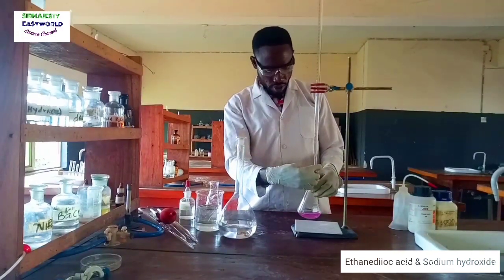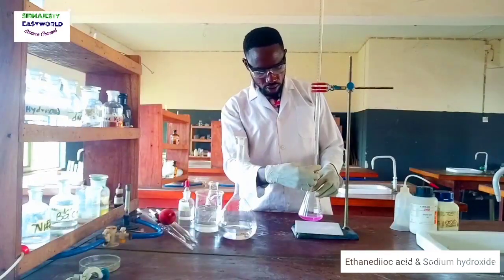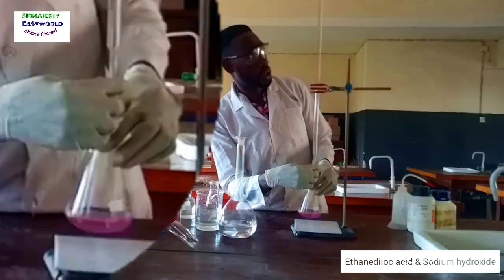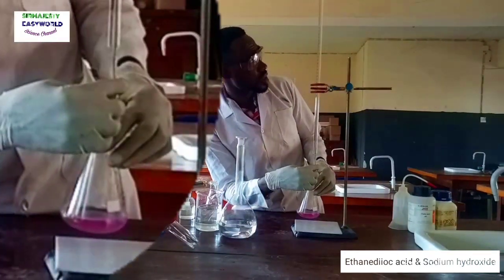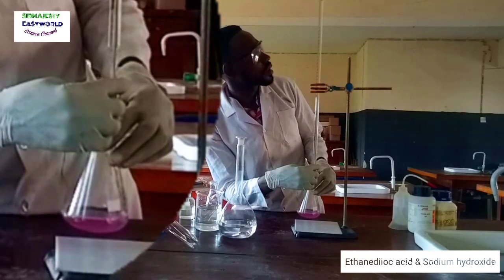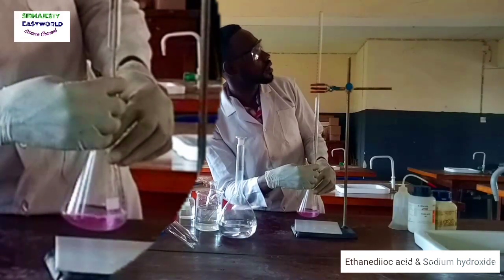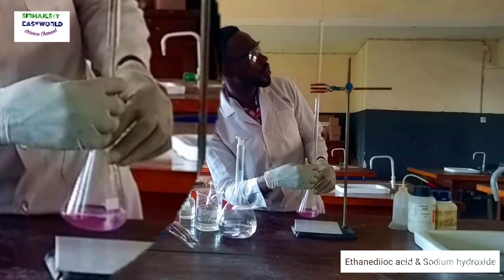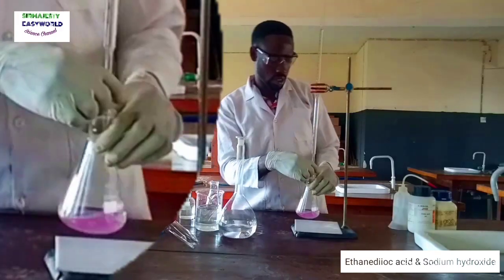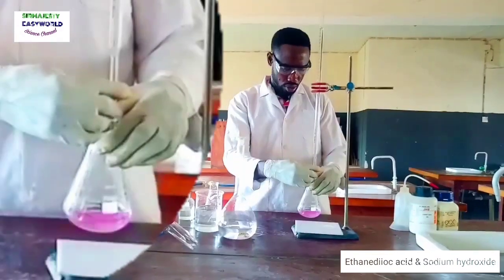Having done my first titration and got the endpoint at 23, I move in quickly until I get close to that value, then I trace it drop by drop.